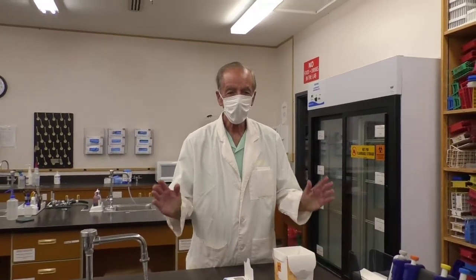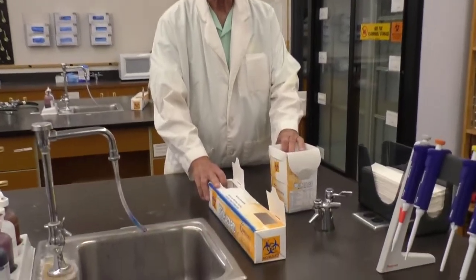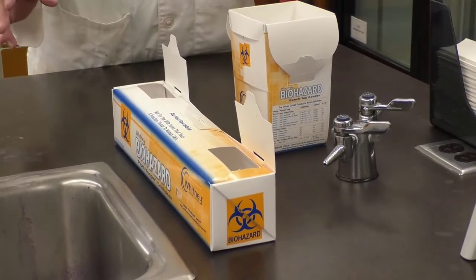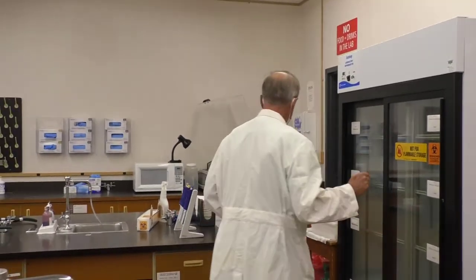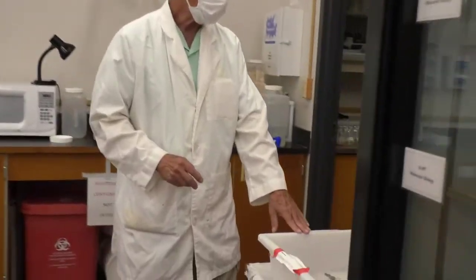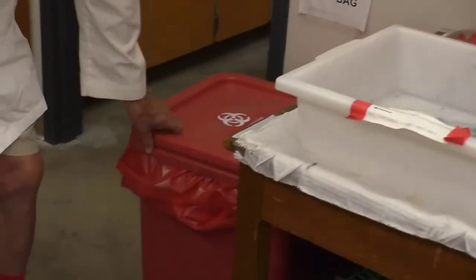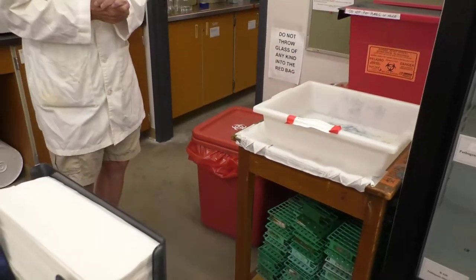So often we'll have microbiological waste to deal with. We have two containers that are designed for disposable pipettes and other materials that become contaminated. So maintaining the control of where we put contaminated substances is important in the laboratory. Okay, let's walk over here. So we have two basic discard areas, areas where we put sharps, areas where we put contaminated test tubes, and then contaminated petri dishes. So control of biohazard materials is extremely important in the laboratory.